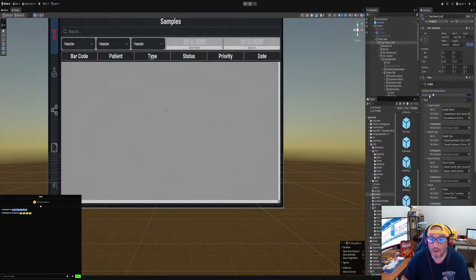So basically, we are in this scene just handling everything that has to do with samples. You can assign a test here, but you're not gonna see any part of the test. You're gonna be able to assign a test and a test type, but you're not gonna be able to edit tests or test types on this scene.